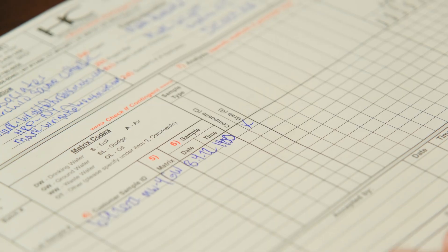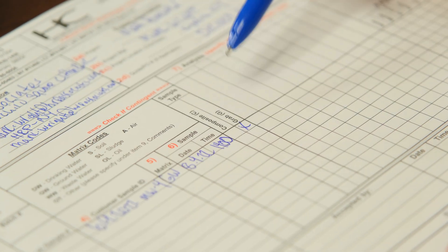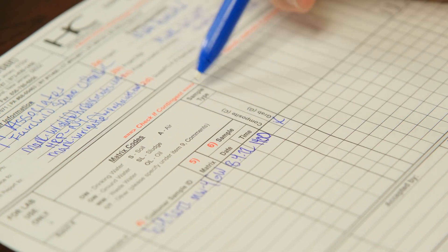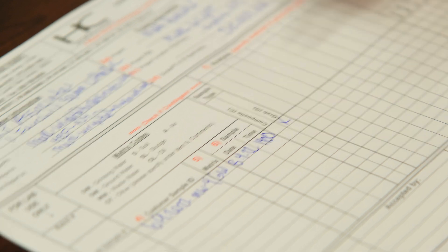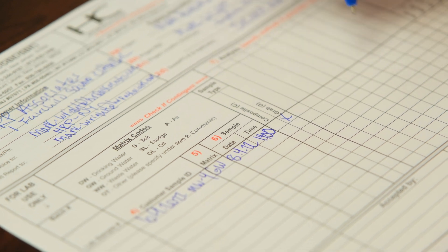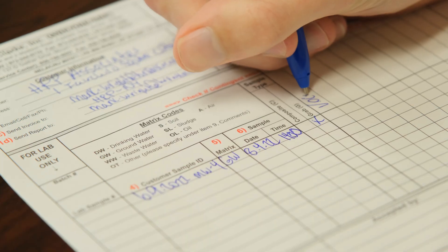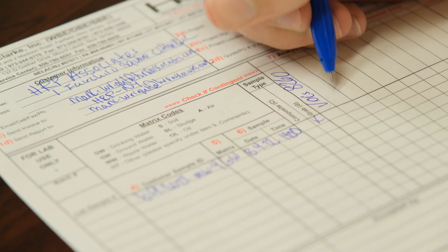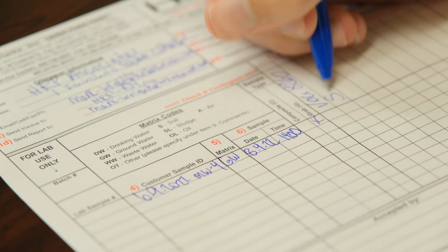Composite or grab sample — make sure you indicate that. And lastly, what type of analysis are you running on your sample? We'll do 8260 VOCs to start with — very common one. We're also running for SVOCs.